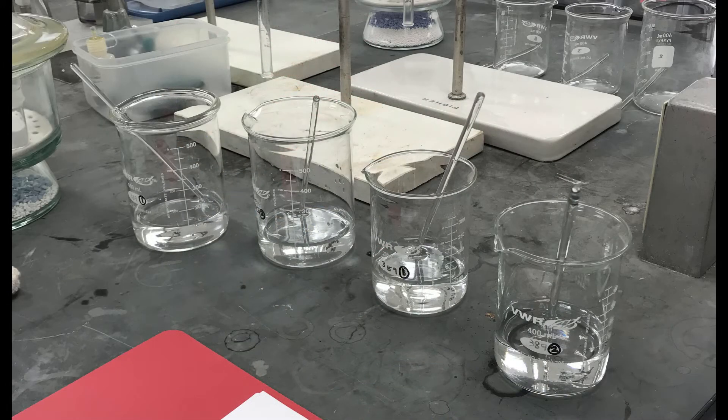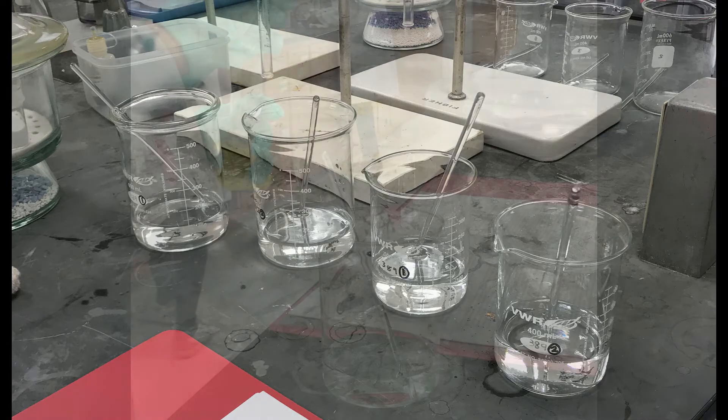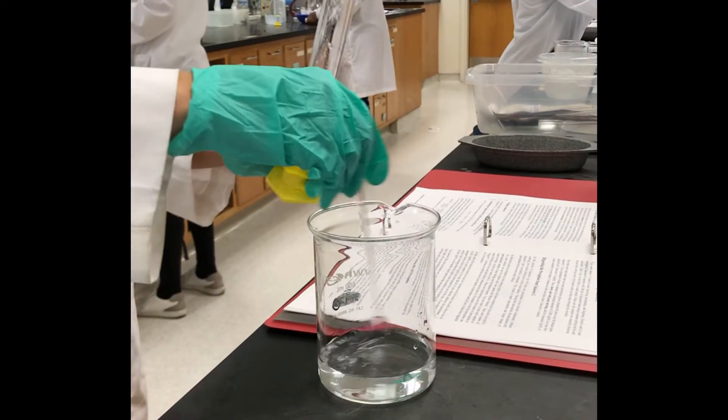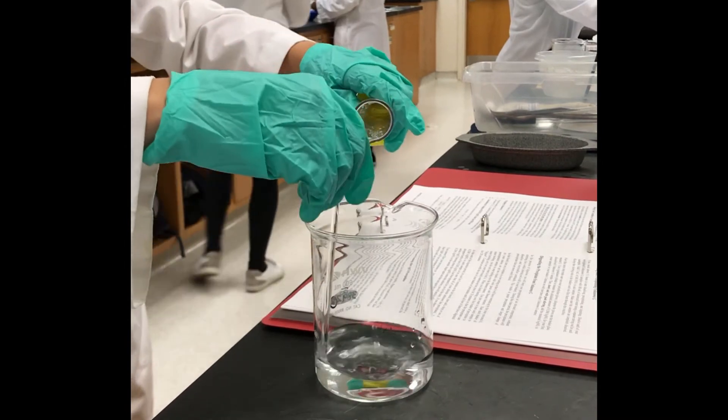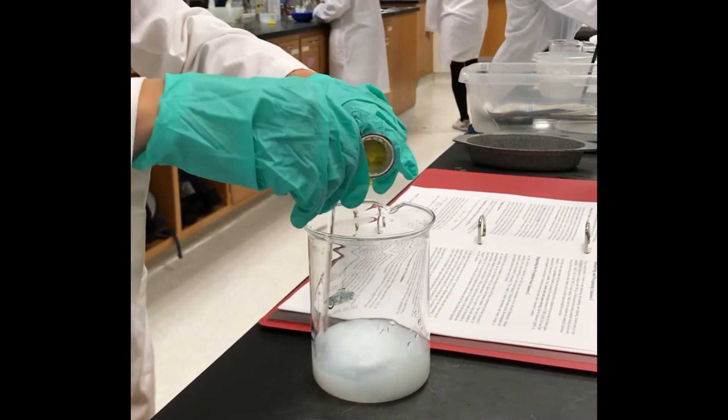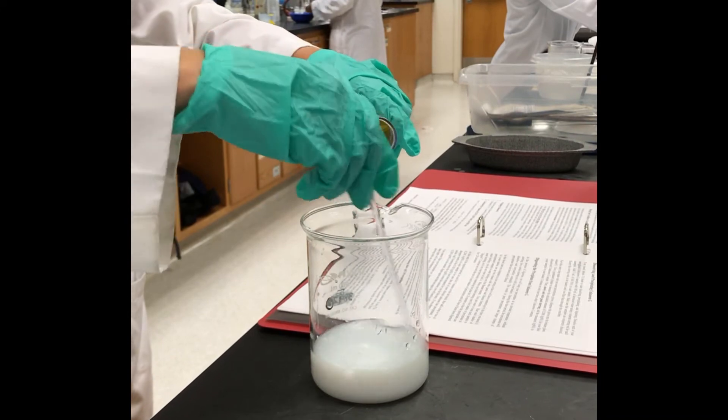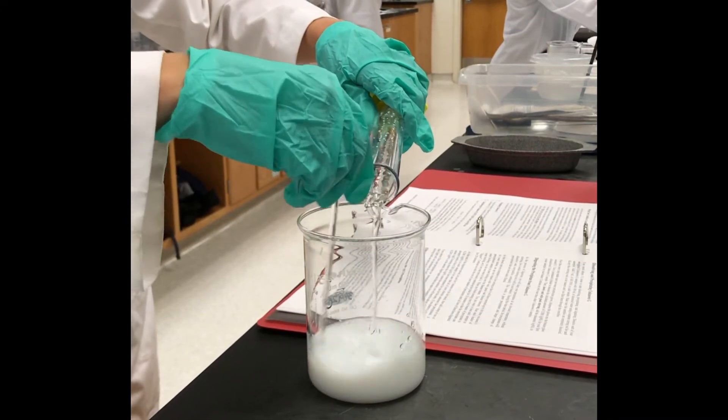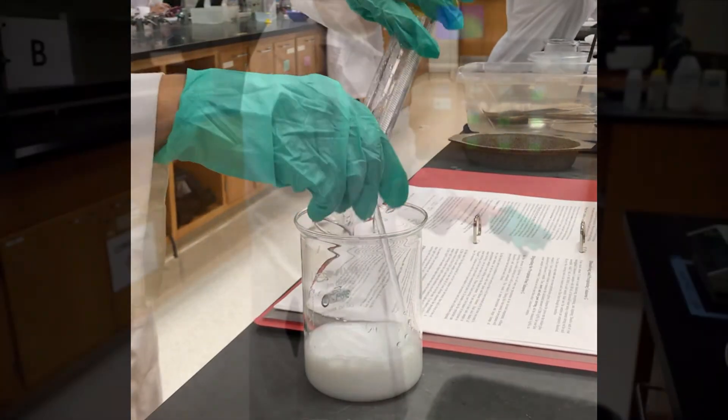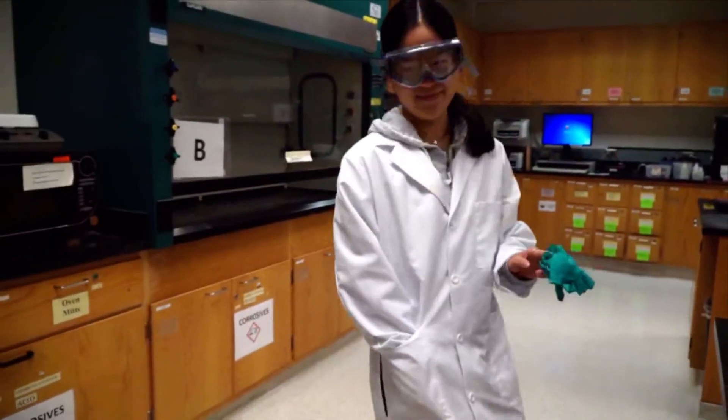Time to get your gloves on because you're about to precipitate with silver nitrate, which can stain the skin. Slowly pour a stoichiometric volume of silver nitrate into your solution. It will precipitate. Prepare all precipitation trials in this fashion. Throw your gloves away in the proper waste receptacle.